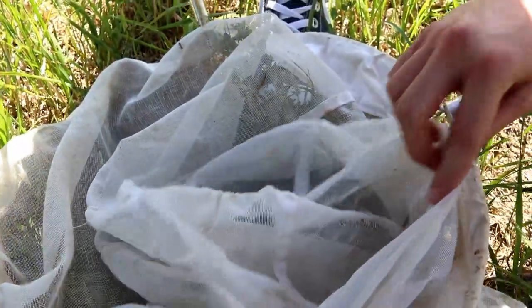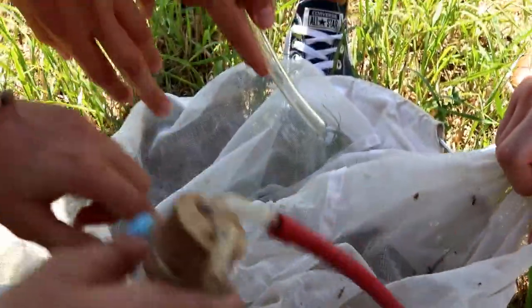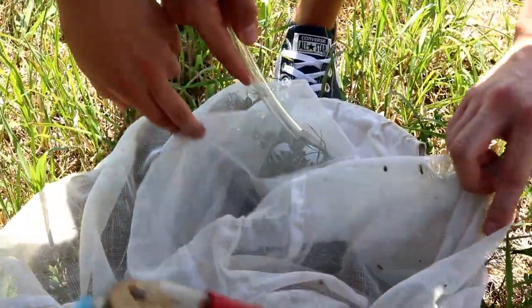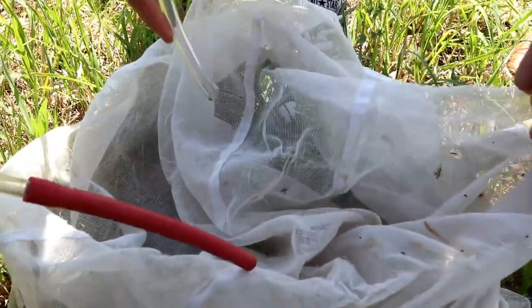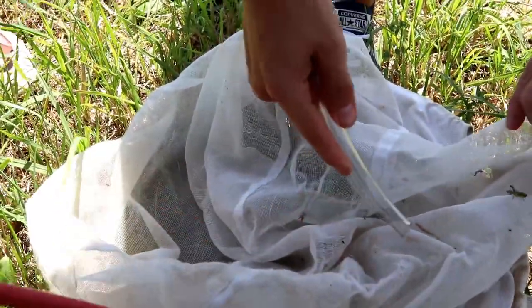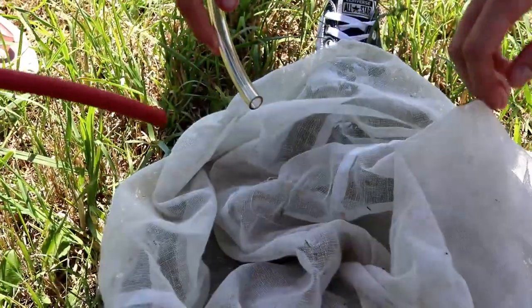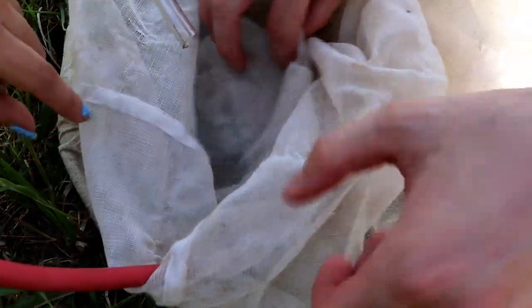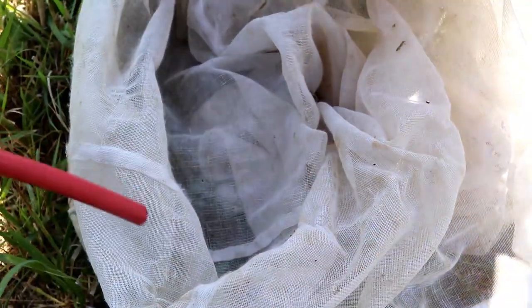After we sweep through the vegetation, there are plenty of insects inside the insect net and now the students are collecting them by sucking them into these glass bottles. Later on we have to sort through them because we will not be using all of them — we are going to select only some of them. We do not want to kill too many of them.